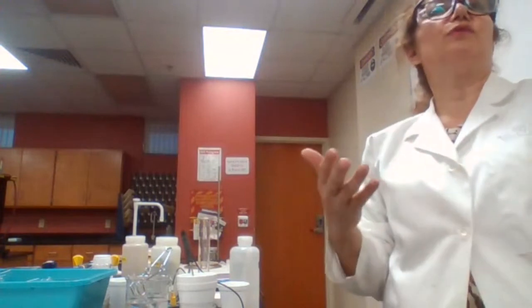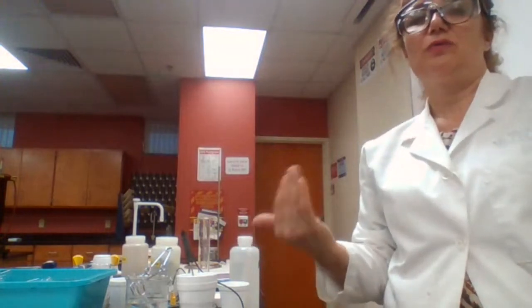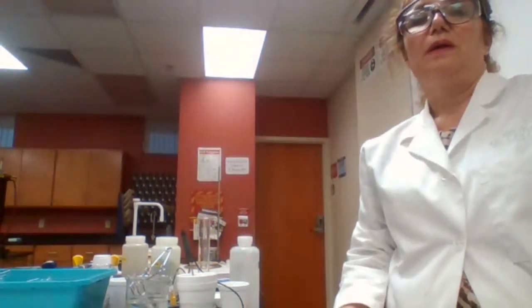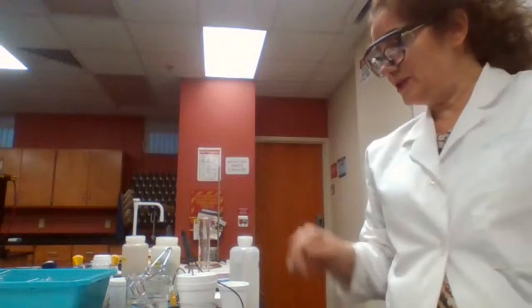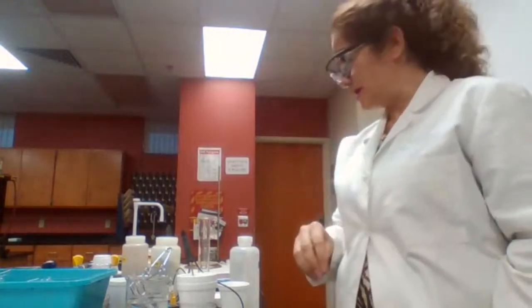Then I'll help you with the calculation, like how to find the formula weight of the salt, because you probably have not covered it in lecture yet. We're going to pull up the periodic table and I'll show you how to do the calculation. But let's finish the experiment first. The second part of the experiment, which is the first column on the last page of the data sheet, is for calcium chloride.